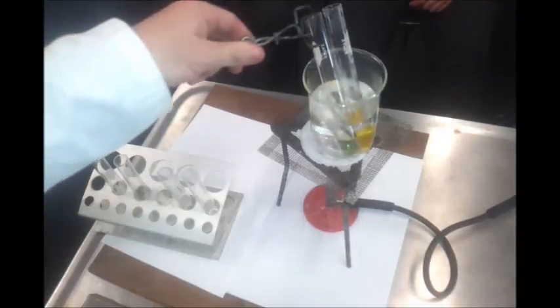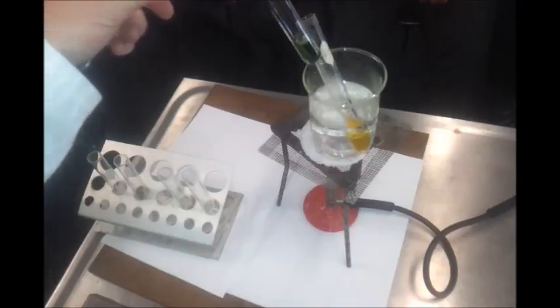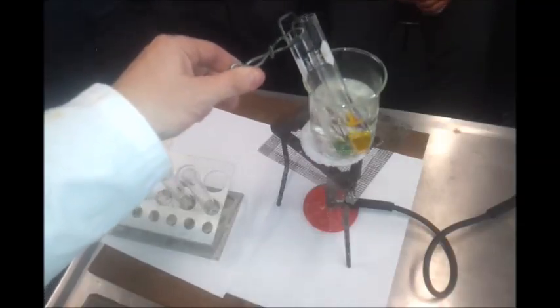And in that time, we have seen that this has gone to a green colour. This green is due to the presence of chromium 3+ ions, and that is a positive test for an alcohol. Now, it doesn't work with a tertiary alcohol, and the reason for that is that what's being formed here, first of all, is an aldehyde. So it's going from ethanol to what we call ethanal, where it's losing 2 hydrogen ions and making a C=O double bond. I'll draw that up on the board shortly and hopefully be able to move the camera to see it. That double bond can't form if it was a tertiary alcohol. It can only happen if it's a primary or secondary.